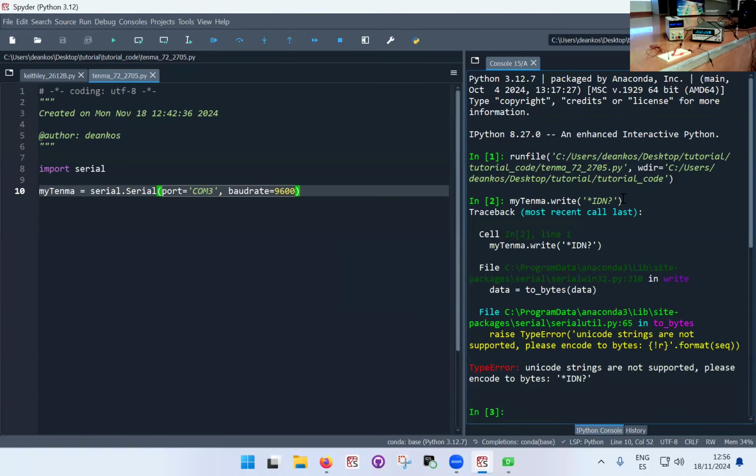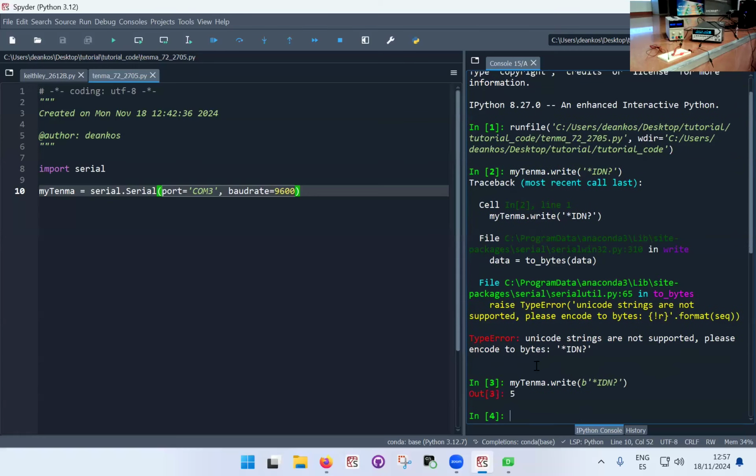Okay, I'm getting an error. Why am I getting an error? Because *IDN?, as it is, is a Python string. And pyserial, as I said, is a more basic type of interface. So I'm sending a string, but this string is not supported. I'm supposed to send bytes. But in Python, it's quite simple to do this, because all you need to do is put a b in front of the string to say that this is supposed to be represented as a set of bytes. Okay, so b, and now it returns something, which again, as before, just ignore it.